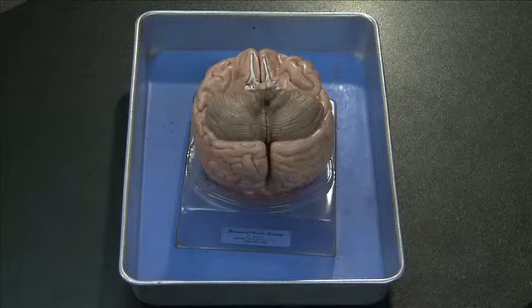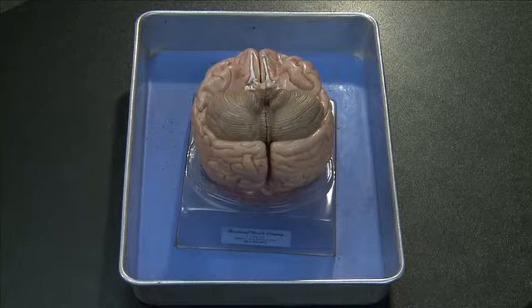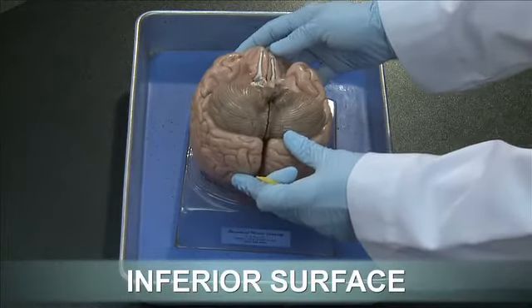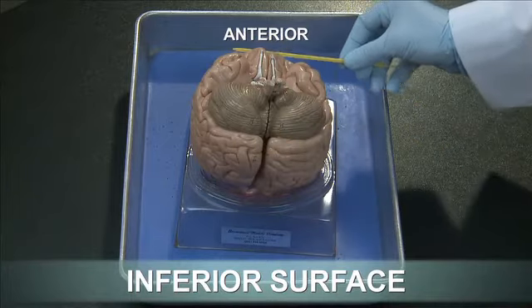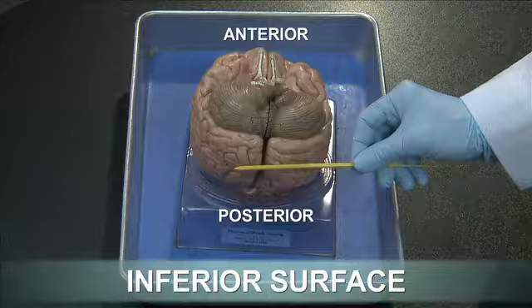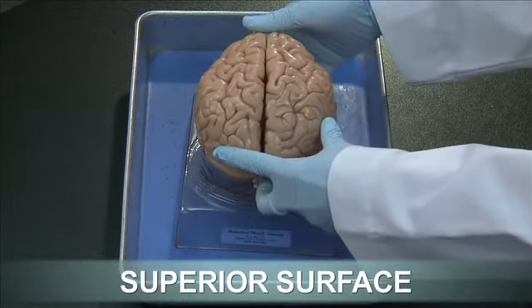The first thing to do when looking at a preserved brain or model of the human brain is to orient the brain. As you can see in this model of the human brain, this is the inferior surface with anterior and posterior parts. If we flip the brain, now we are looking at the superior surface of the brain.